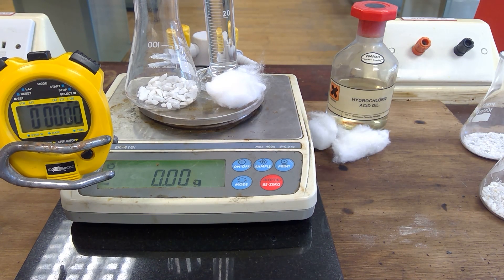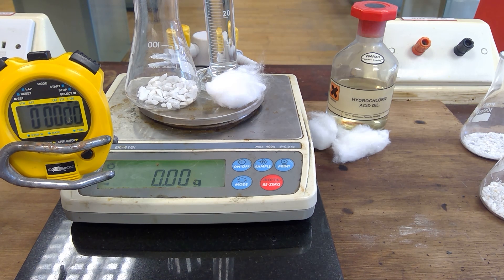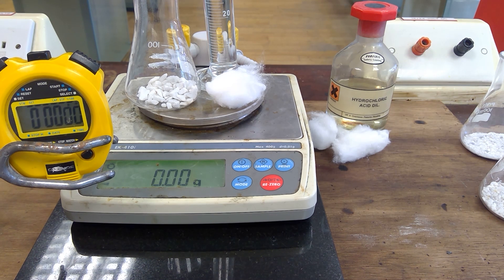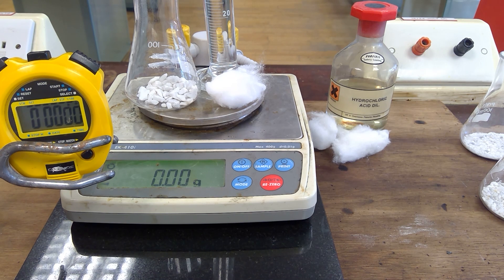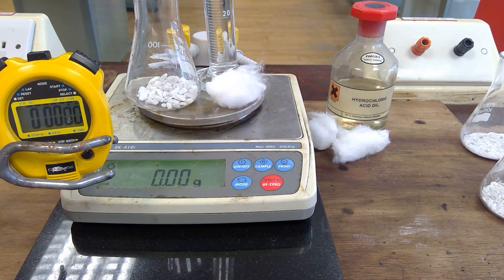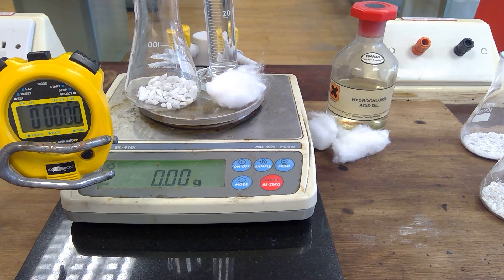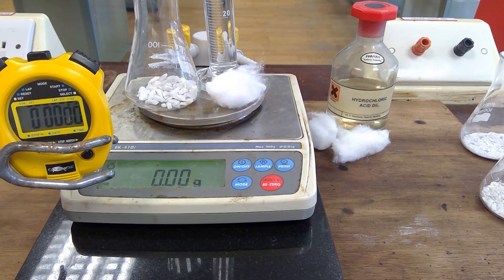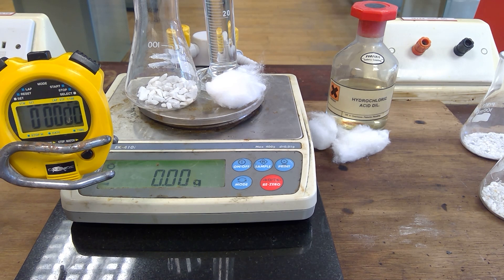Your job will be to take a recording at 30 seconds and at 15 seconds thereafter. So the recordings will be at 30 seconds, 45, 60, 75, 90, and so on until a total of four minutes has elapsed. So this is large marble chips.